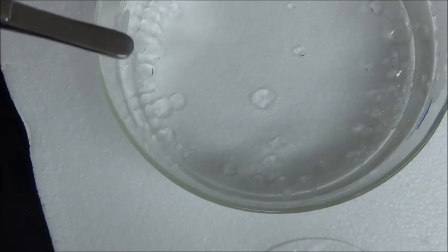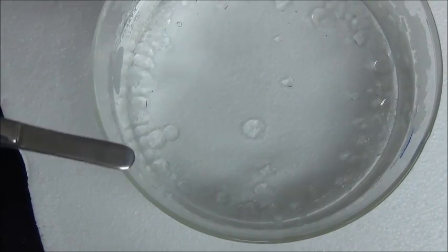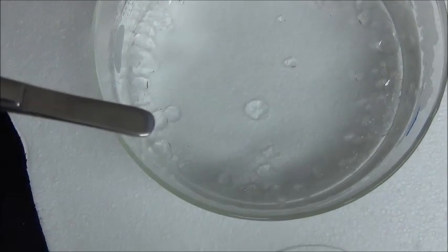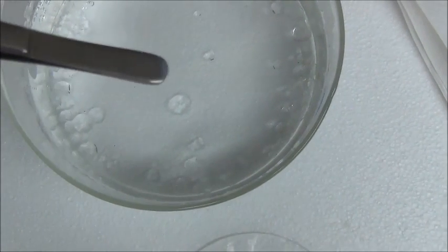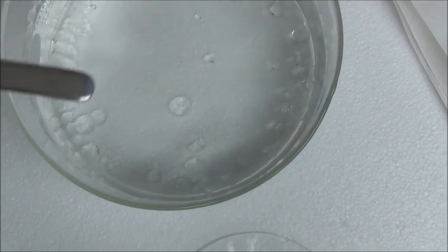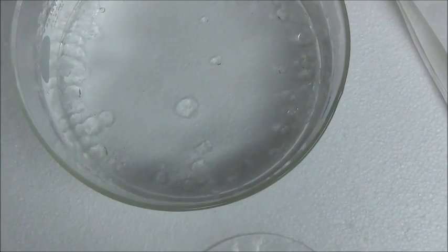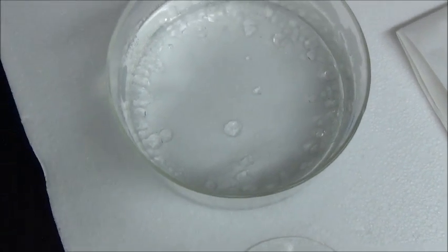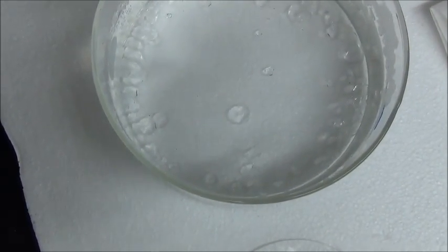On the edge here we have a bunch of crystals that have all run into each other, and these won't really be good for growing very nice large single crystals. Whereas this crystal is really ideal. When it comes to harvesting, we'll harvest that crystal and a few others, and those will serve as the seed crystals for the large crystal growth part of the experiment.